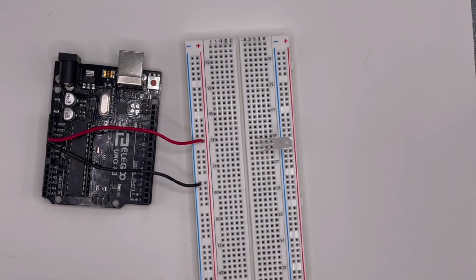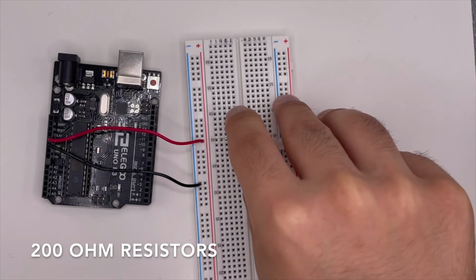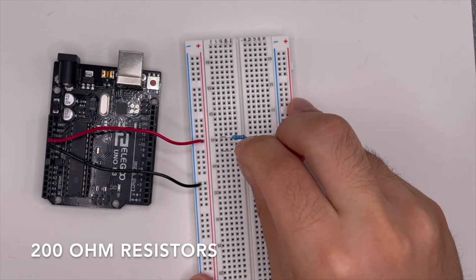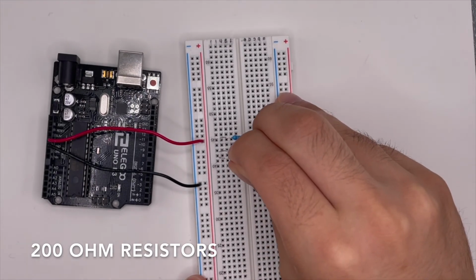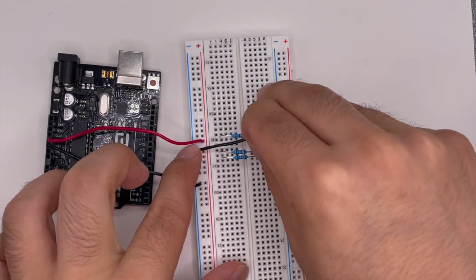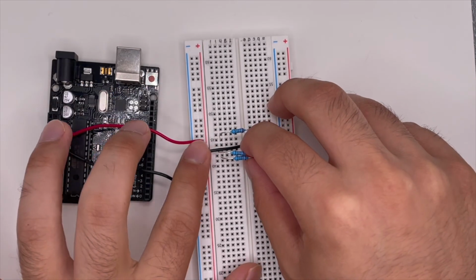Now, we also need to have resistors between the LED pins and the Arduino board. So let's place resistors on the non-ground pins, as you can see here. We know that this one is the longest ground pin, so we will not be placing resistors on that. Skip one, place a resistor there. And the next one, another resistor here. Make sure that's bridging the gap between the breadboard. And finally, for that one, we will also be grounding the ground pin, so from the negative bus line onto the pin we skipped over for the resistors.